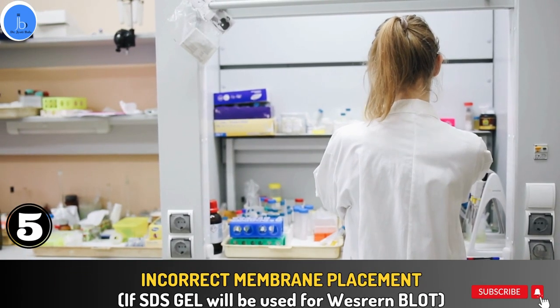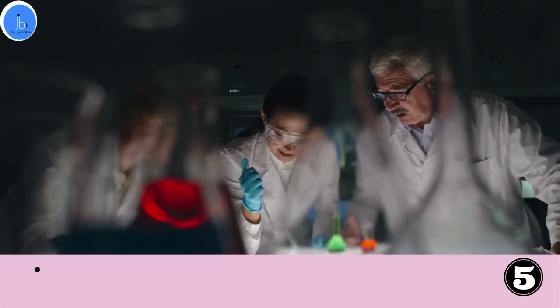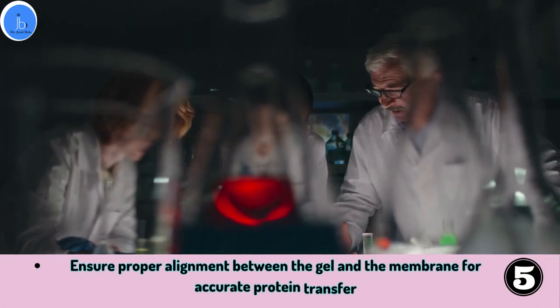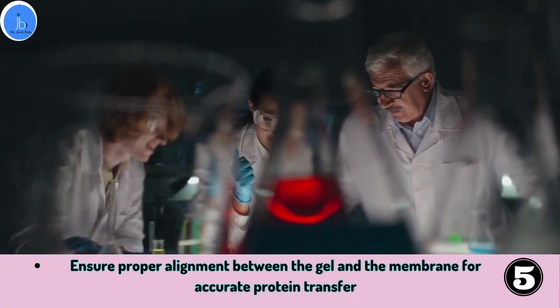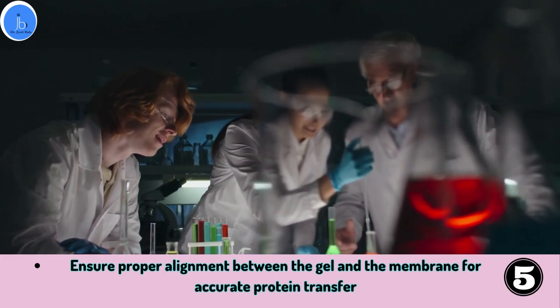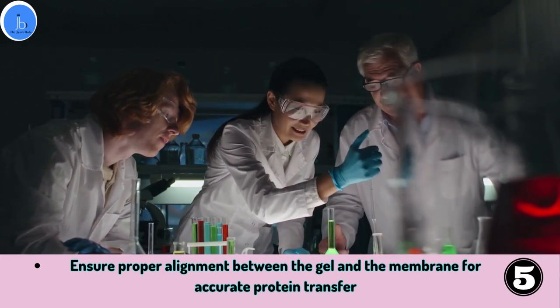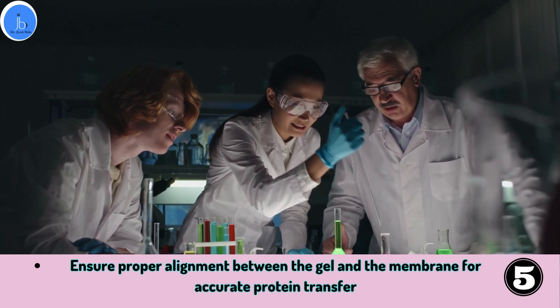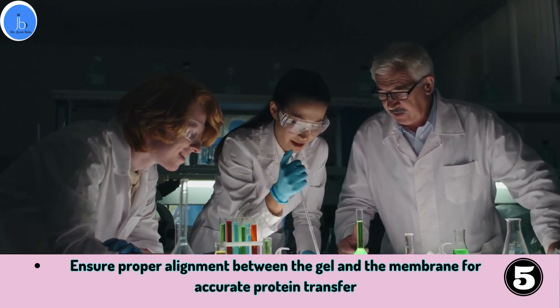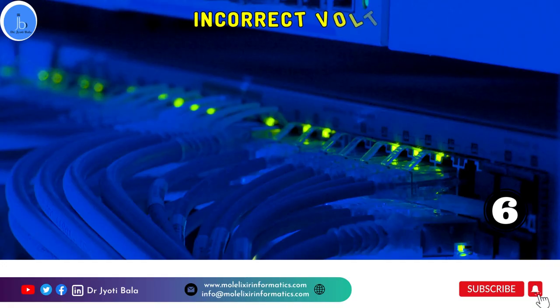The next mistake is incorrect membrane placement. Incorrect placement of your membrane during transfer can result in incomplete or uneven transfer of protein. Ensure proper alignment between the gel and the membrane for accurate protein transfer.